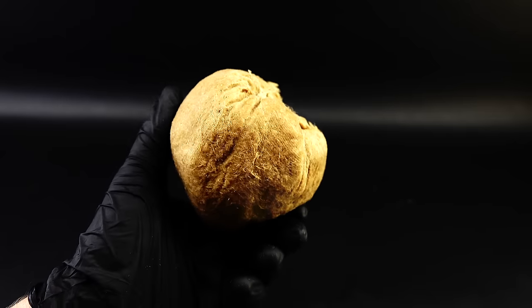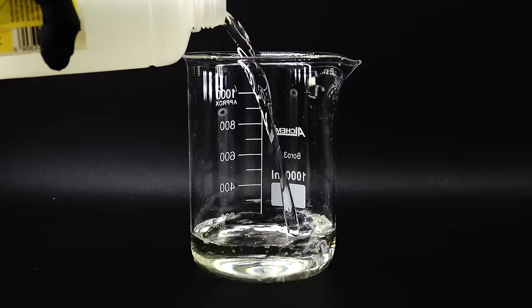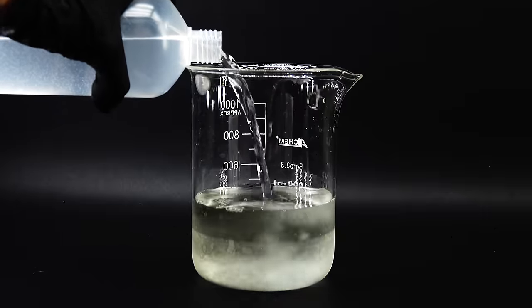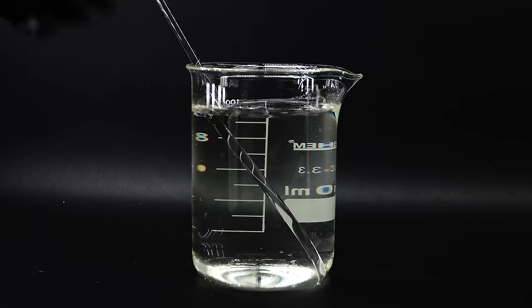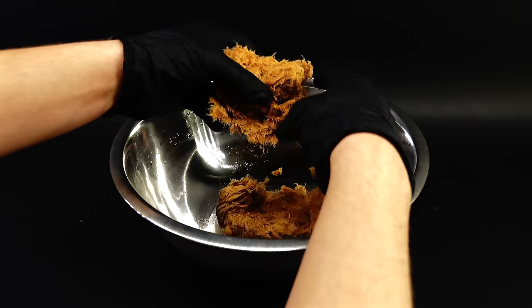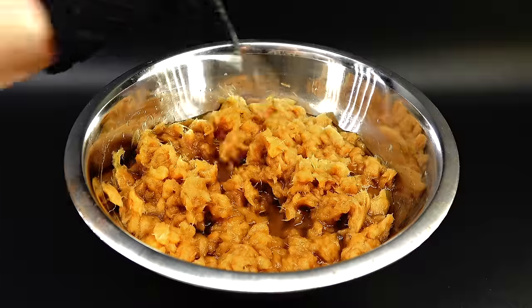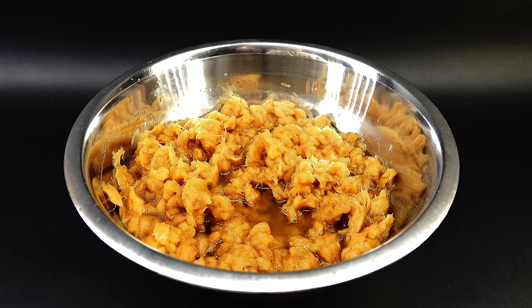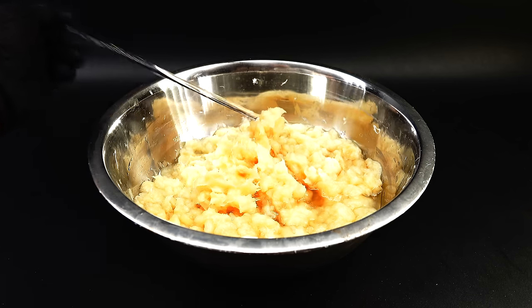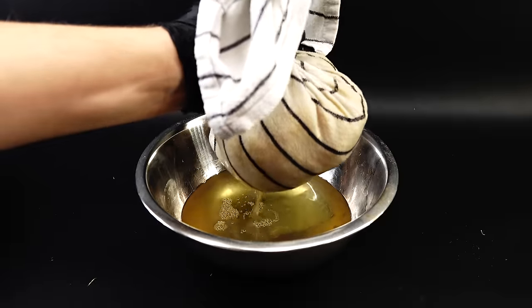Sodium hypochlorite bears a striking resemblance to sodium chloride, which is just table salt, and has this additional oxygen atom, making it really chemically angry, and capable of destroying things like lignin while leaving the more stable cellulose behind. To bleach my wood dumpling, I have to bathe it in a dilute solution of sodium hypochlorite. I got 300 ml of some industrial 15% sodium hypochlorite bleach into a beaker and diluted it down with around 600 ml of distilled water, making a 5% bleach solution. I got my ball of wood pulp into a bowl, broke it up into smaller pieces, then poured in the whole bleach solution, and after just a few minutes the pulp looked much brighter. To unlock my bleach's full potential, I left it to marinate my pulp overnight.